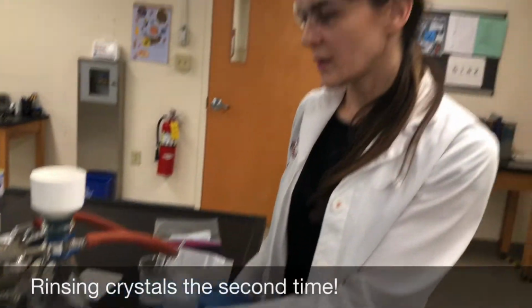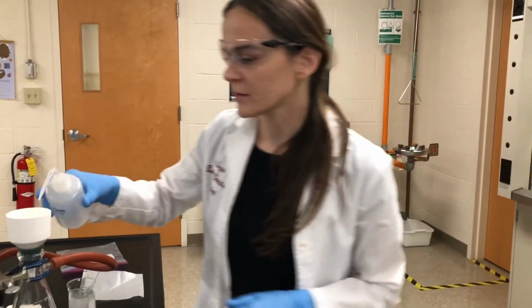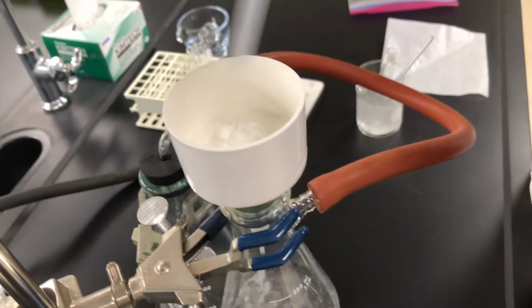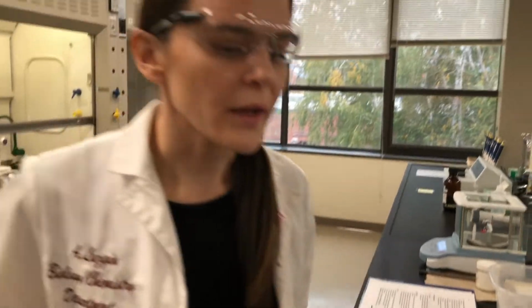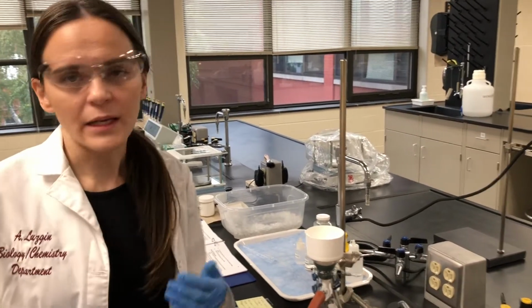Okay, so now we're doing the second rinse of the crystals. Again, when you rinse the crystals, you want to rinse them completely, not just in one spot, and I'm going to time the reaction for another 2 minutes. You can notice that the aspirin crystals are becoming more pure because the acetic acid, the vinegar smell, is not as prominent as before.